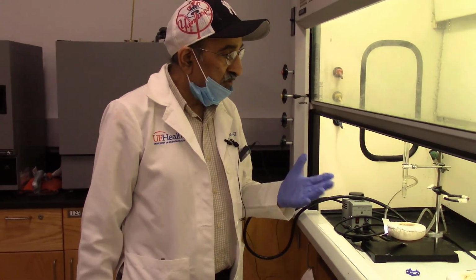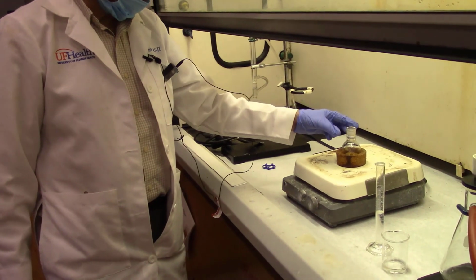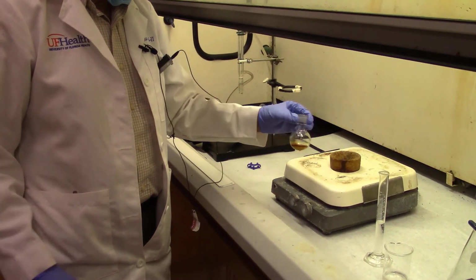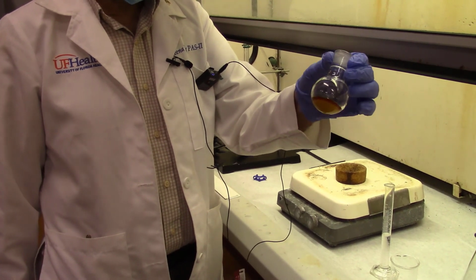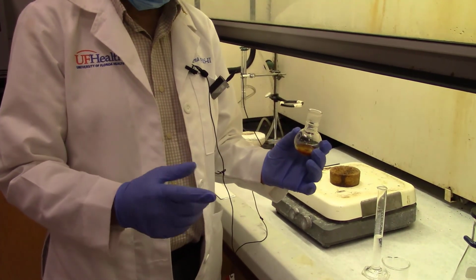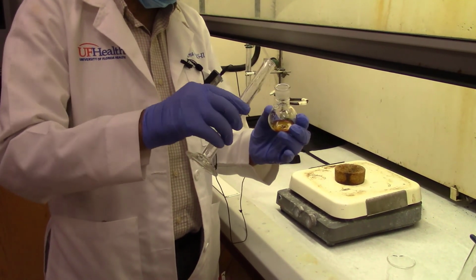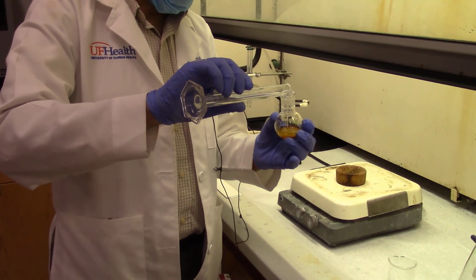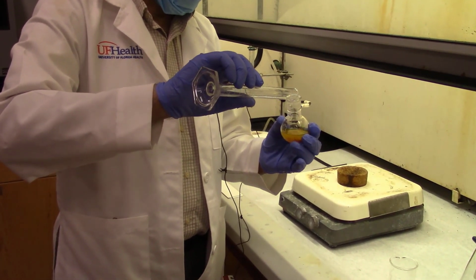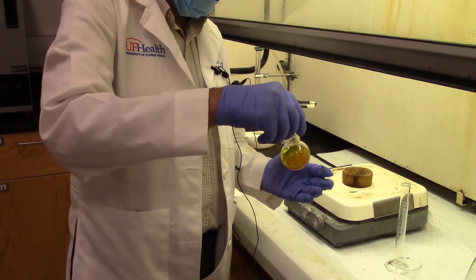So I've been stirring the reaction mixture for about 40 minutes. During this time, this has become a gummy mass, which is difficult to stir with the magnet bar. Magnet bar is stuck in there. The reaction is complete. So I basically need to add some solvent to it, not to dissolve, but just to disengage it from the flask, to make it a little bit softer and easier to swirl.